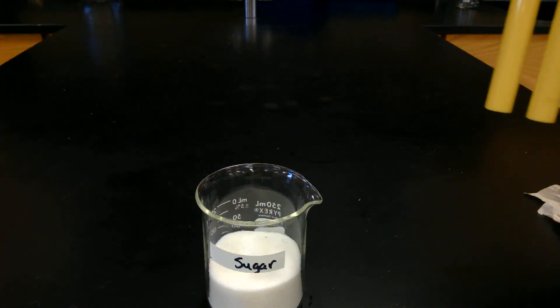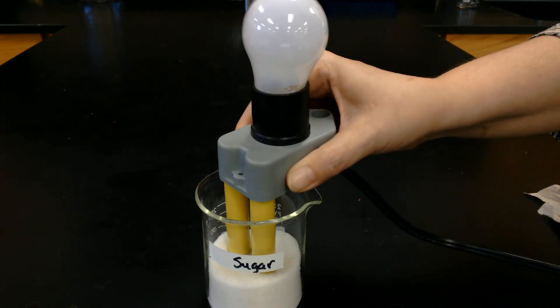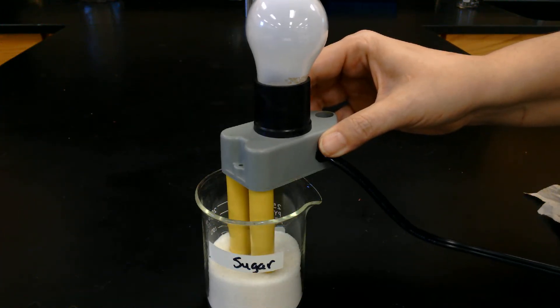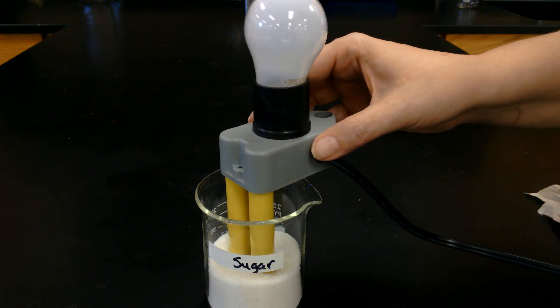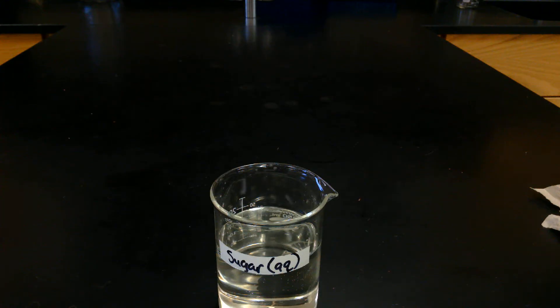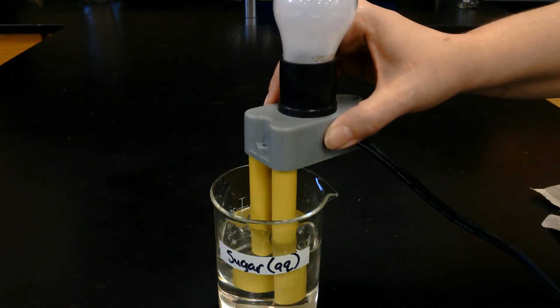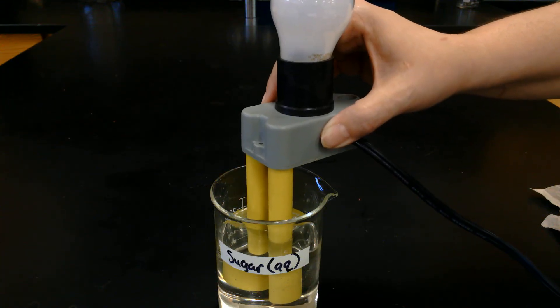Next we're going to try some solid sugar — that good sweet stuff. Go ahead and make your observations of solid sugar. Now let's try some sugar dissolved in water, some sugar water. Go ahead and make your observations on that one.